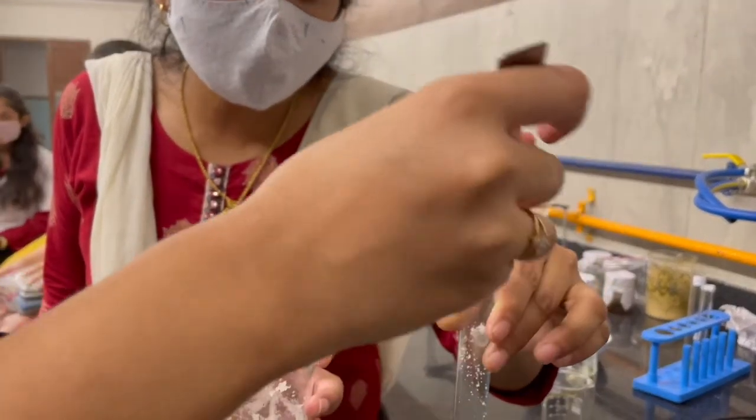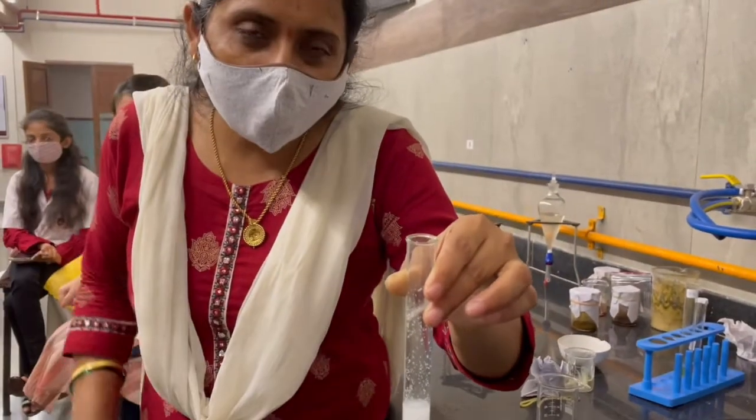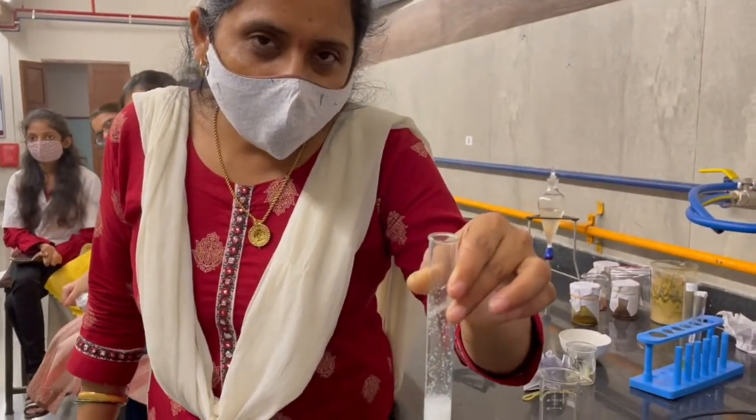Take the mixture in a test tube to separate out the oil layer and liquid.